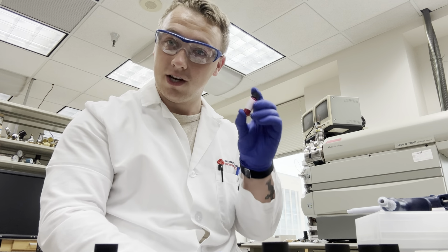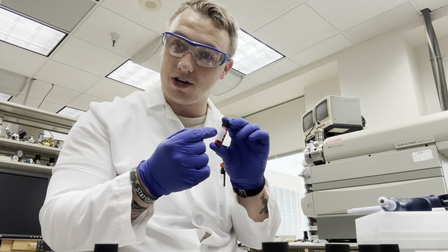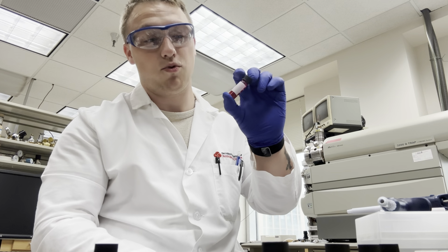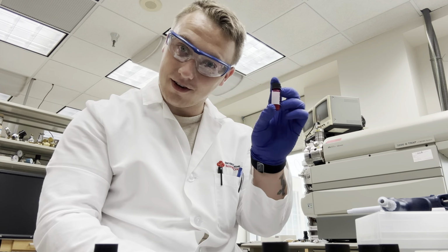I hope this helped. Don't forget to label these containers with when you filled it up, the concentration of the solution and what the solution is, and what the solvent is. That's important as well. So, enjoy. Good luck with your dilution.